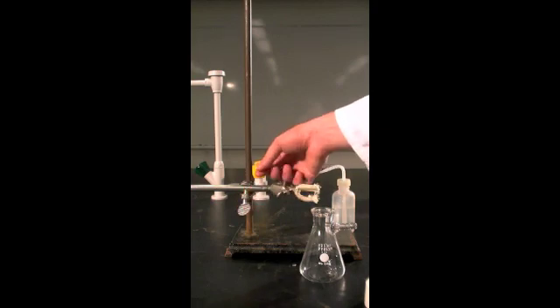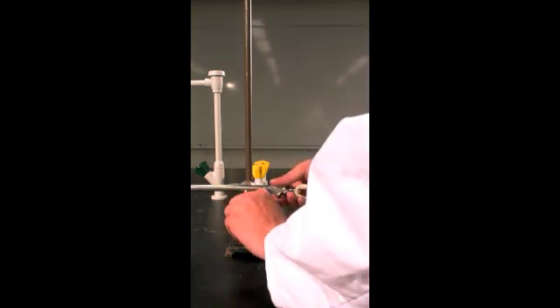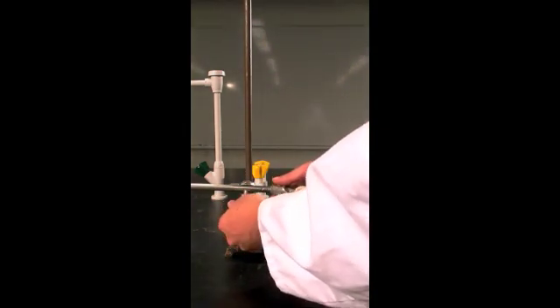You want to make sure that the open part here is pointing up so that if it is loose, it won't drop all your glassware immediately.